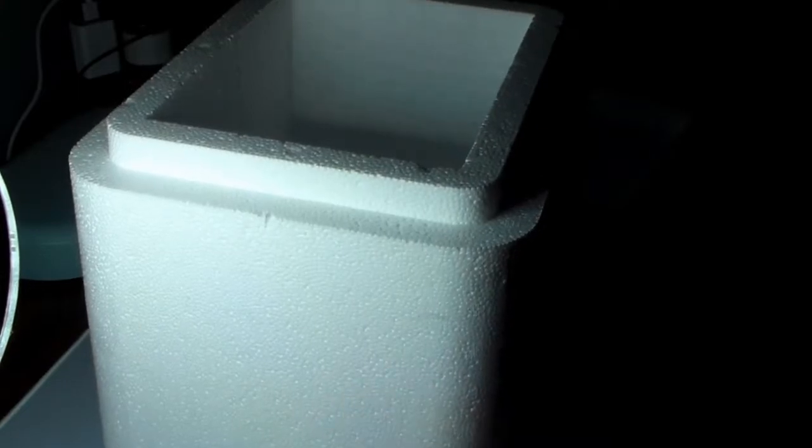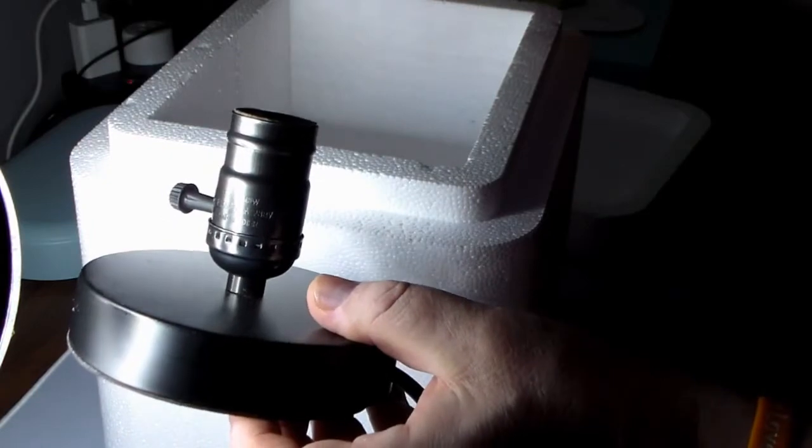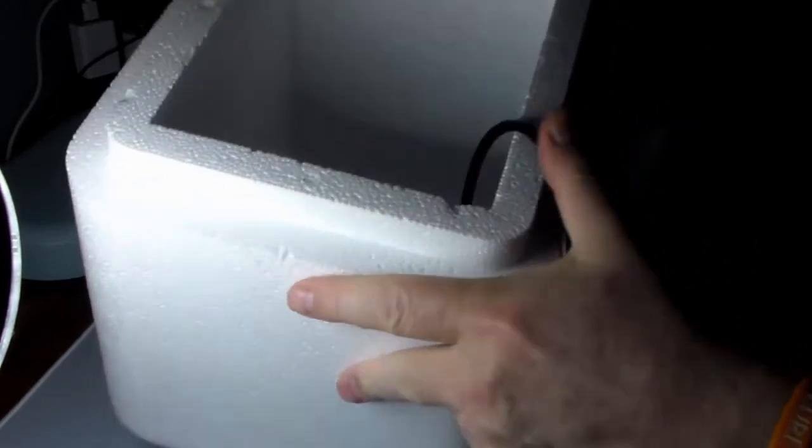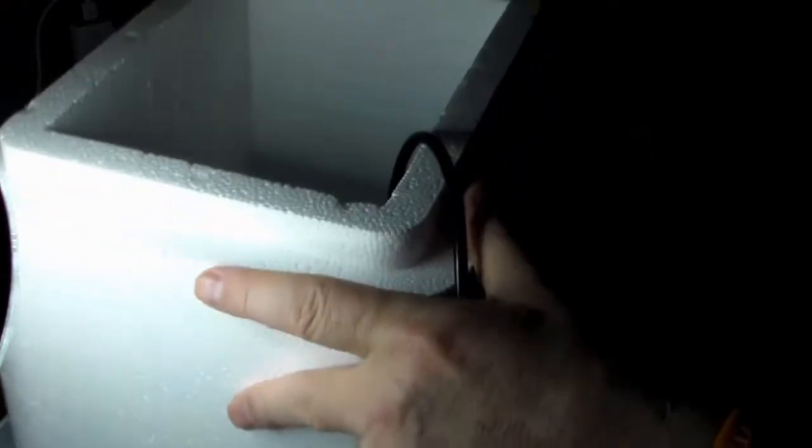Okay? So here's how we're going to do this. I'm going to drill a small hole in the side of this. It won't take much. I'm going to run one of my Starlight base lamps, and run the power cord through there. I'm going to drop that right into the styrofoam like that. Now I'm going to connect that to the power using this.